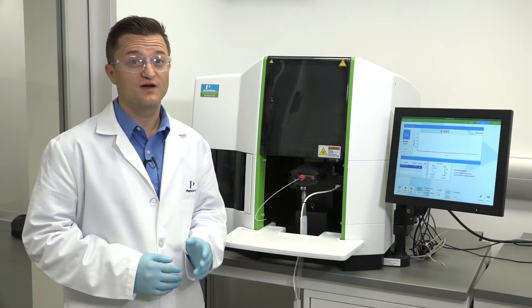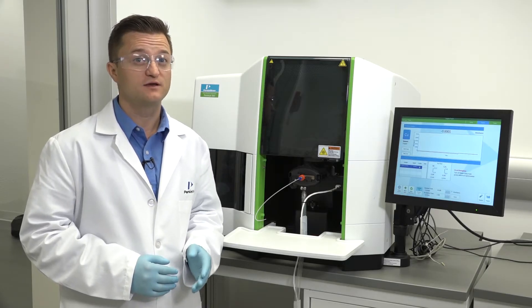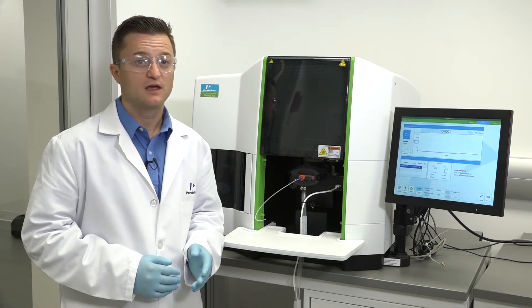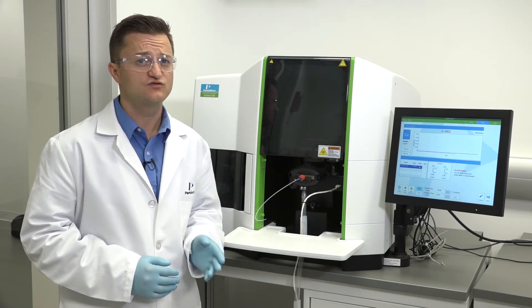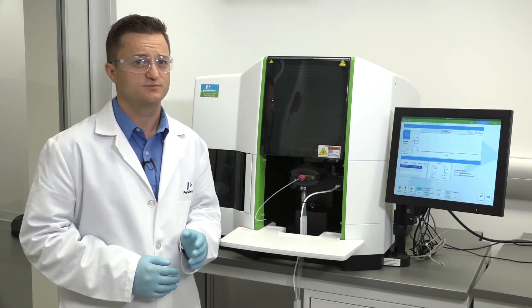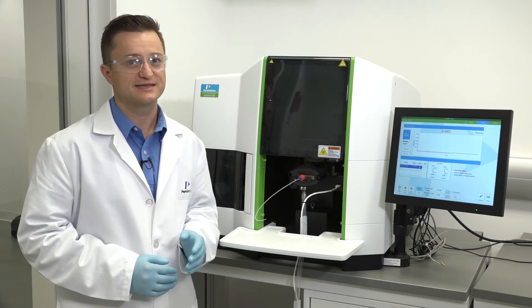The Pinnacle 500 provides a simple method of burner head alignment. After watching this video, you will have the opportunity to visually see how to accomplish this process quickly and easily each time.